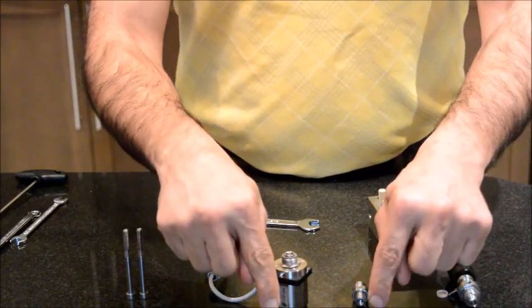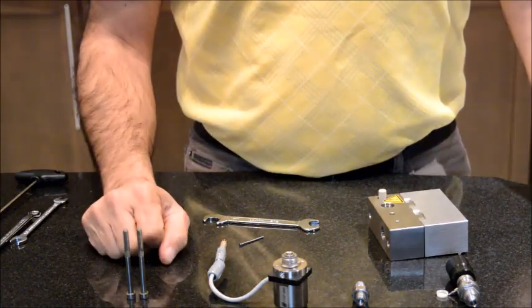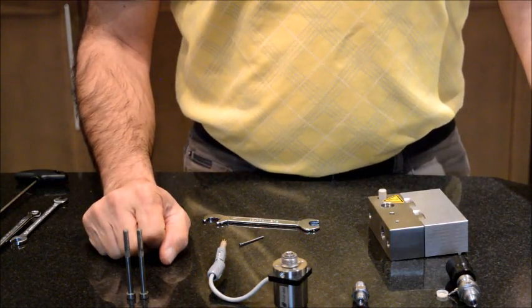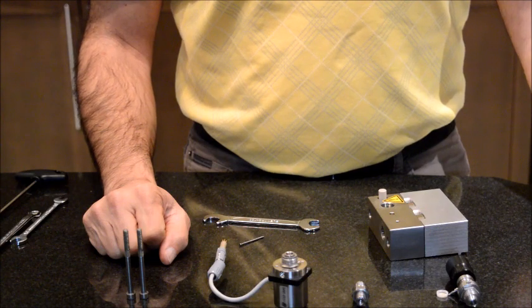By replacing these two parts, you will solve your flow fluctuation or no flow at all.